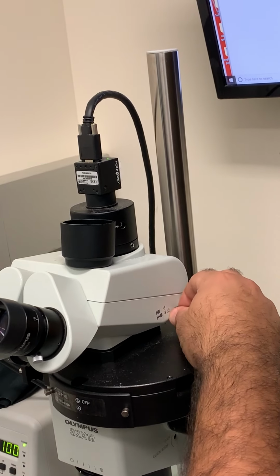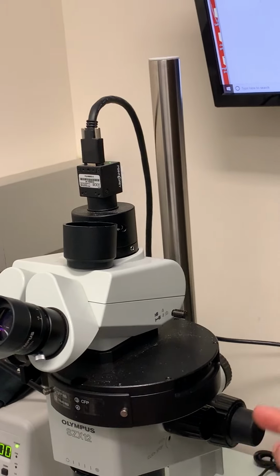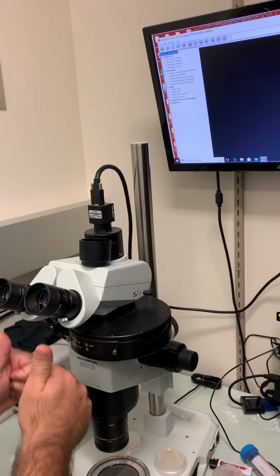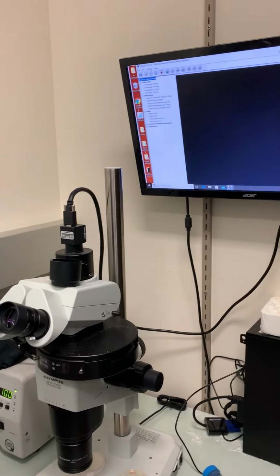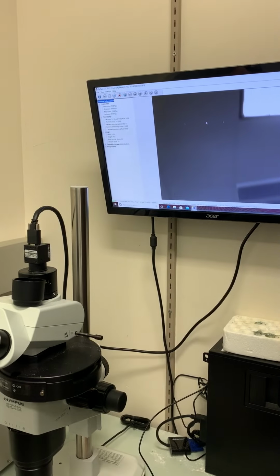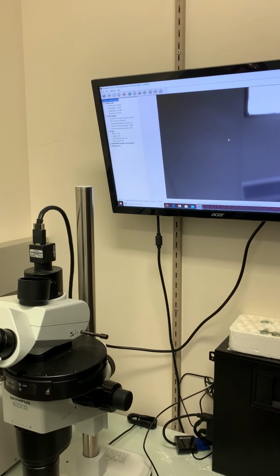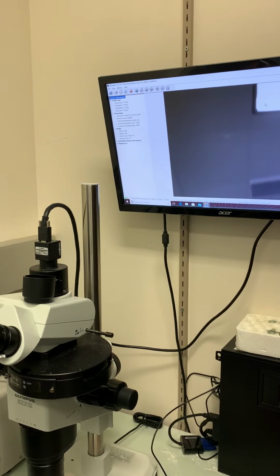Now, on top here, there is a puller that you have to move very gently because it moves a piece of glass inside the microscope. You can see there are some icons in there. When the puller is all the way in, all the light is going to the eyepieces and no light is going to the camera, which is why you don't see an image here. And when you pull it, now some light is going to the camera, which is why you see this thing here.